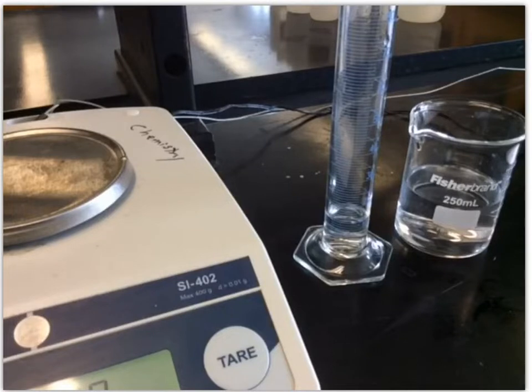So what we need to do is measure mass and volume for several samples of this salt solution. We're going to do five trials in this hundred milliliter grad cylinder, and we're going to do them back to back. We have that starting solution in there, which will give us our zero reading. Then we'll add a sample of about 10 to 15 milliliters of our salt solution. We will take a new mass and volume reading. So we will have initial mass and final mass and initial volume and final volume corresponding to that 10 to 15 milliliter portion that we're adding. Then you can take the final values and subtract the initial, and that'll give you the mass and volume of what we've added.